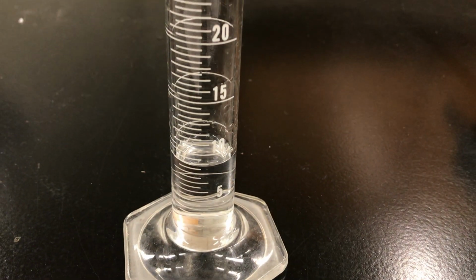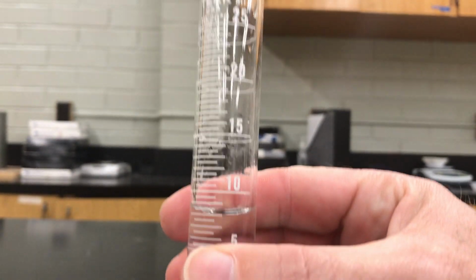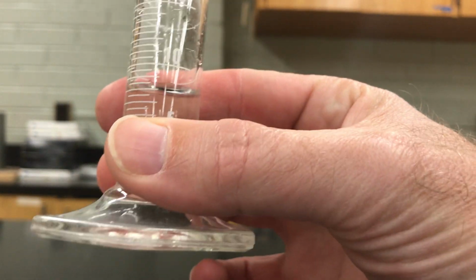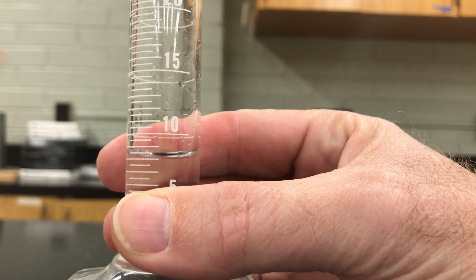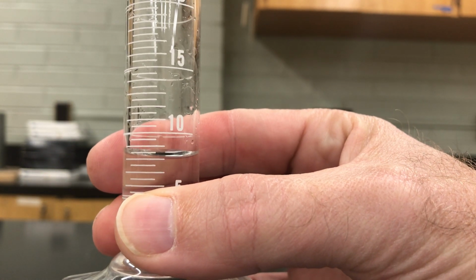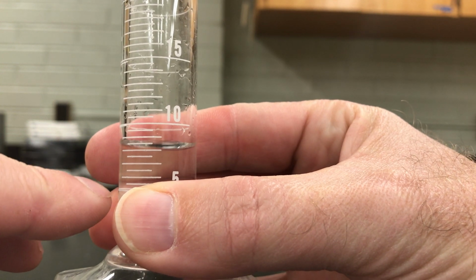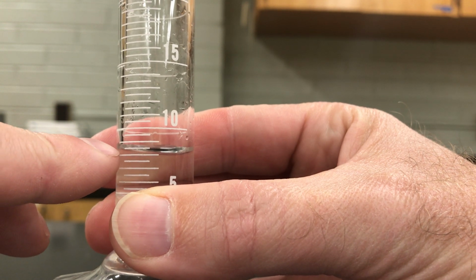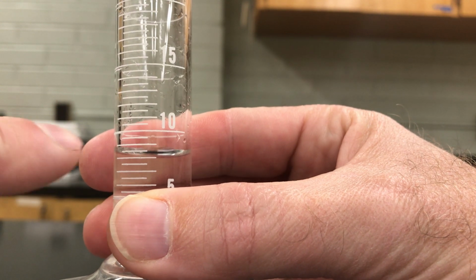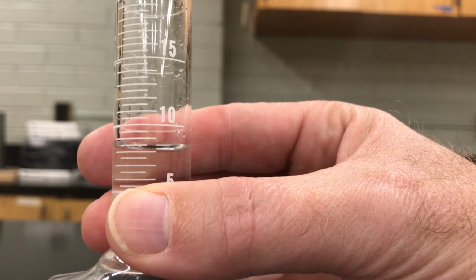So first thing we need is that volume, all right? Mr. Radford's going to hold that up there, try to get as level as we can. We want to look for the bottom of the meniscus, which is that little dip. This kind of makes a U shape because of the properties of water. It clings to the walls. And if I read that, this is 5 milliliters down here. I go up 2 lines at 6, 2 lines at 7, 2 lines at 8, and it looks like the bottom of that meniscus is right at about 8 milliliters.